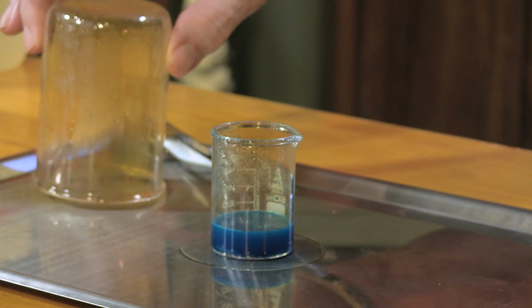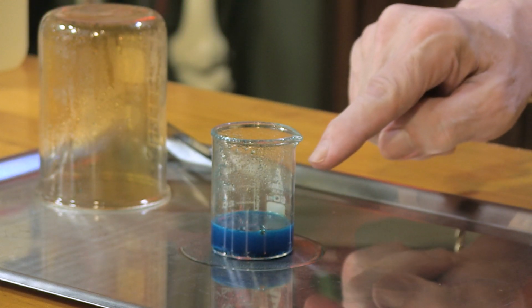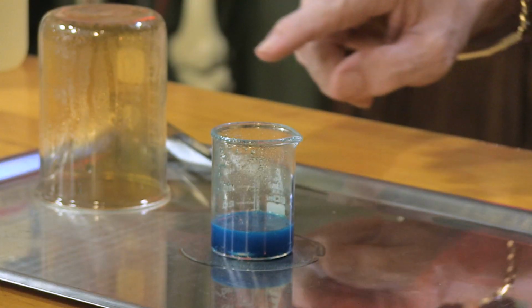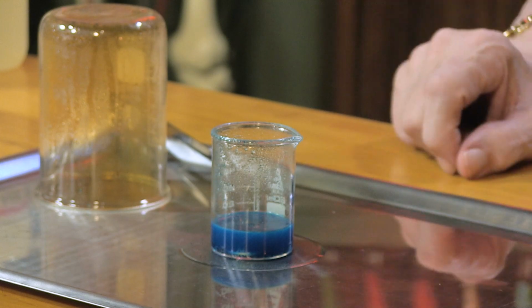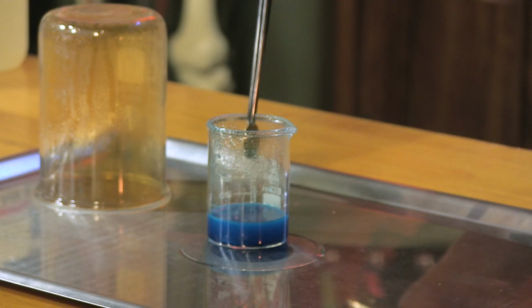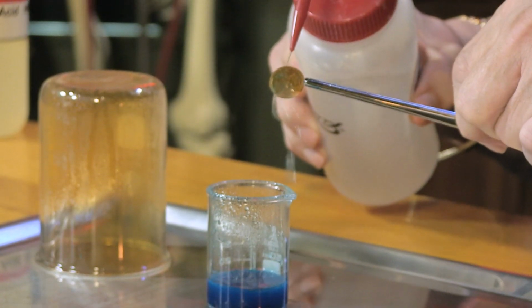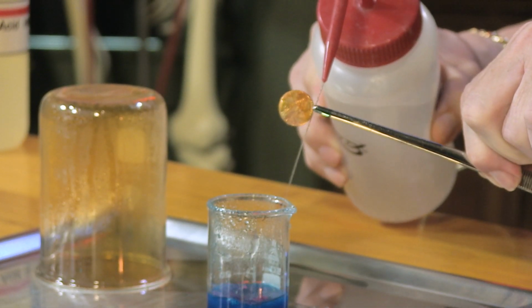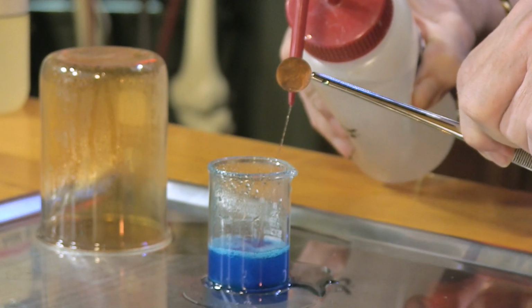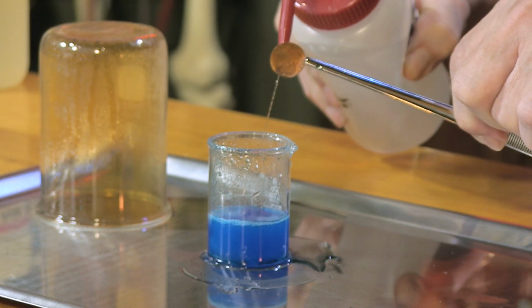And if you look carefully now, you can see a pretty blue solution. That copper nitrate solution in there. And we have some nitrogen dioxide gas, the brown gas. And I don't think the pennies have been completely destroyed. Ah, there she is. And I can take some water and I'll just rinse it off. Woo! Shiny new penny. And if I add a little water down here to the beaker, kind of spread that out, you'll see that nice blue color, that's the copper nitrate solution. You can see how nice and pretty blue it is.